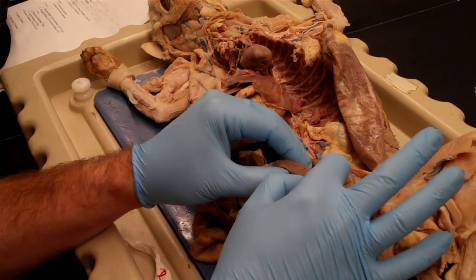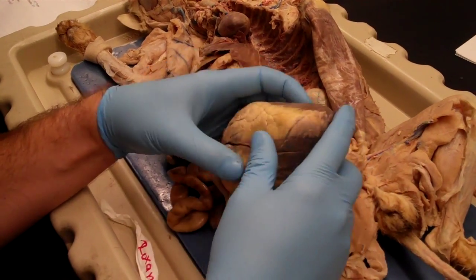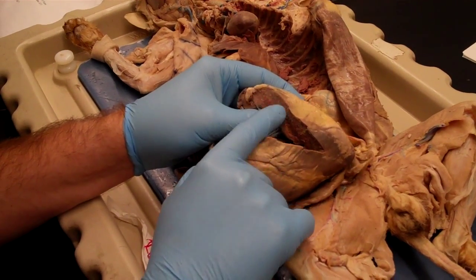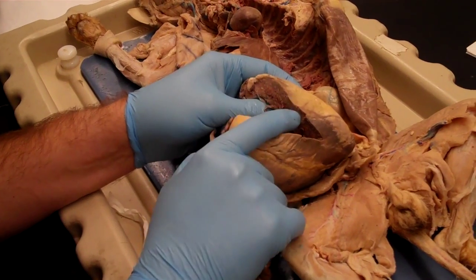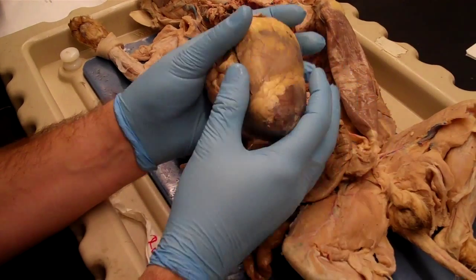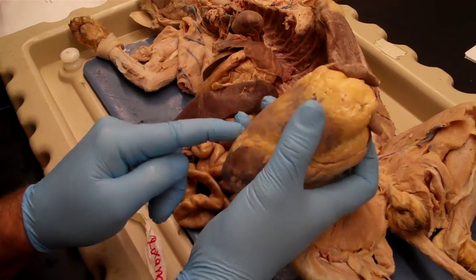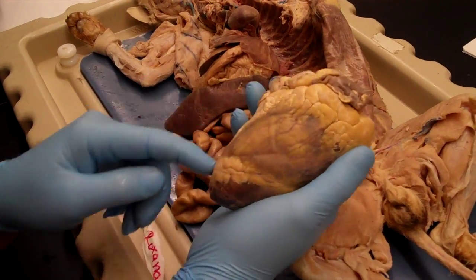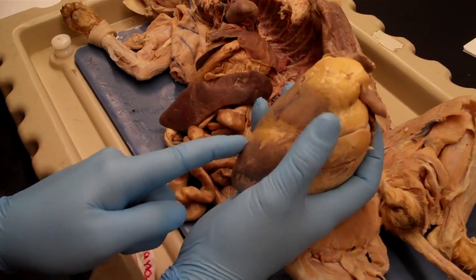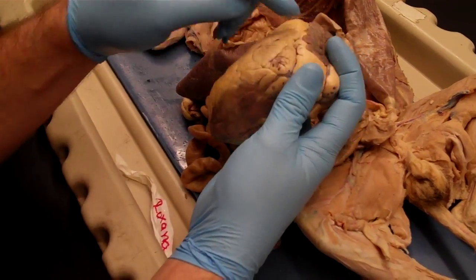But I was saying the right ventricle is relatively thin-walled, maybe less than half an inch in the sheep heart. If we flip over now to the left ventricle, you can see that it's almost an inch thick, probably 7/8 of an inch on this guy. So that's another way you can tell. But if you're looking at it and you don't have the luxury of looking in the heart, you should always be able to tell regardless, because these grooves, the interventricular sulci, or interventricular grooves, are their technical name. Just look for this yellow line that goes down to the apex and then bounces back up. Just try not to get it confused with this second one.